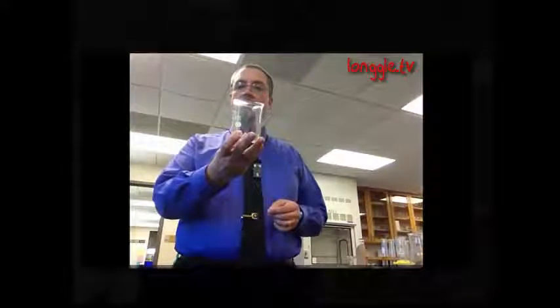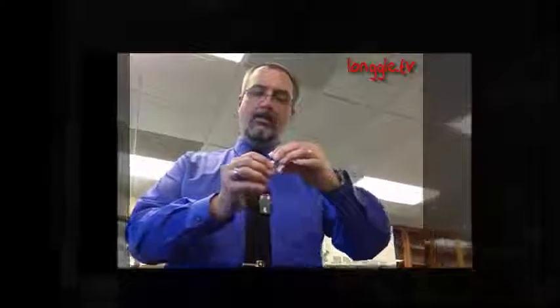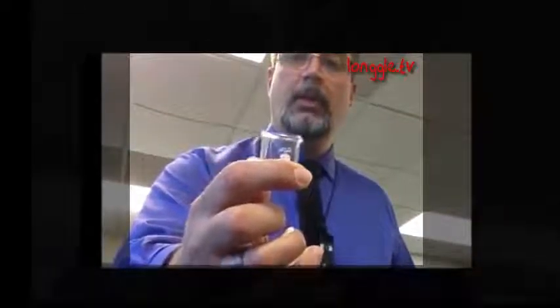This is a 250 milliliter beaker, and again, you'll see it's got numbers on the side, but we don't use those numbers for anything. And then they go very large, and they even get down to very, very small. This is a tiny little 10 milliliter beaker, and isn't it cute? It's cute. So a beaker has straight parallel sides. It may or may not have numbering on it. It's just used to hold stuff.